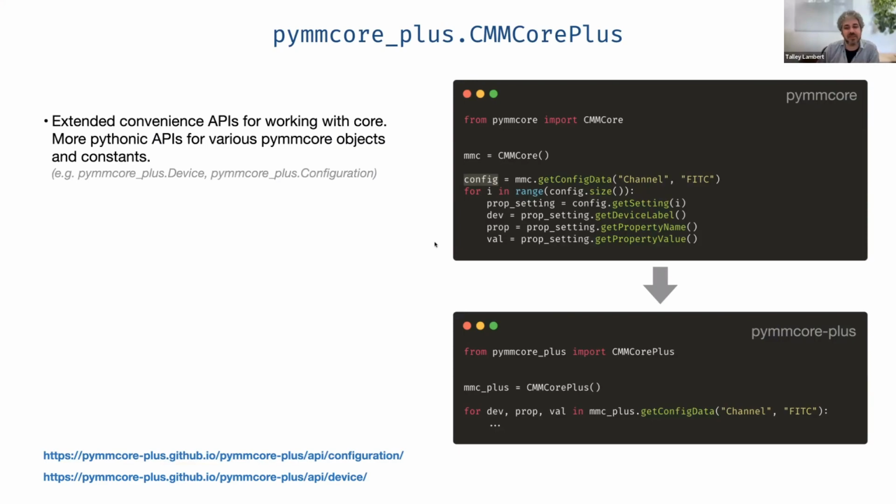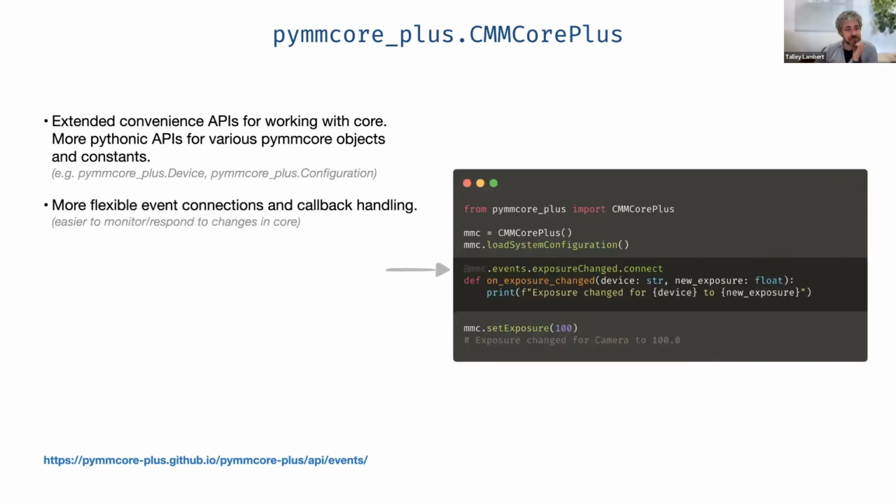And in many places throughout the code, by using subclasses that implement Python's standard dunder methods, we can create a much more Pythonic interface with iterators and mappings and sequences that just behave more like you would expect in a Python world while still being subclasses of PyMMCore. So it won't break any of your usage here, but you can opt into a cleaner API. There are these event connections and callbacks.